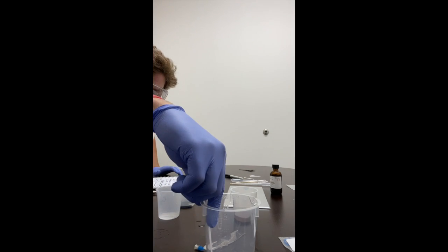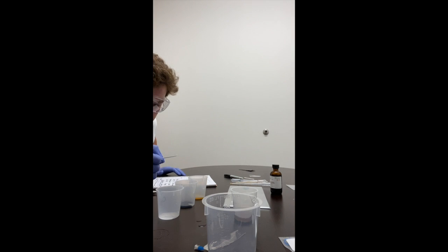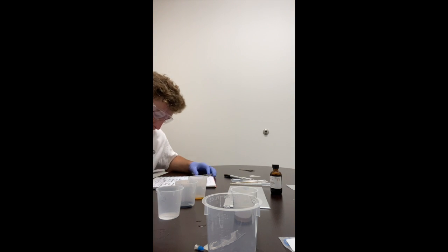So that's been in there for about a minute. So it's yellow with a little bit of green.